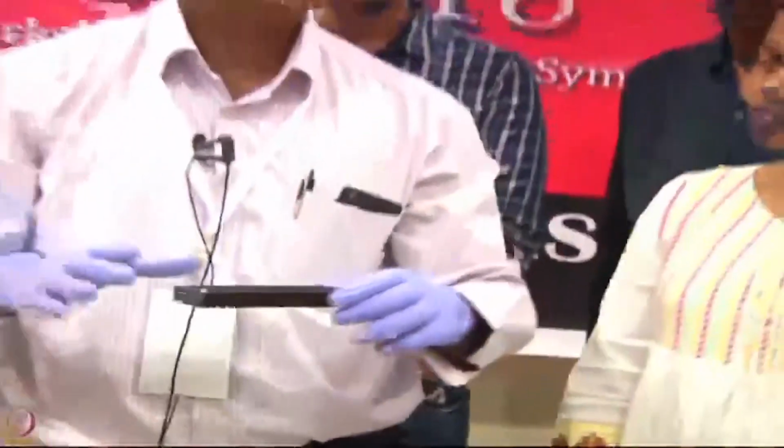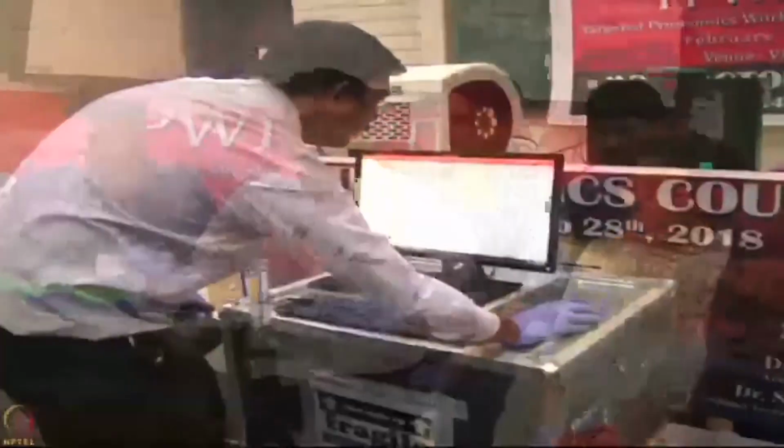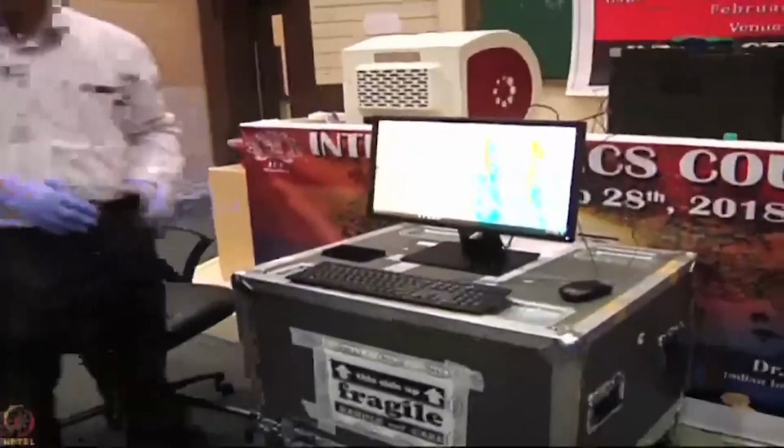So the last well I kept blank because of zero concentration. Okay, we have done the plate preparation. Now we can go for the experimental plan.